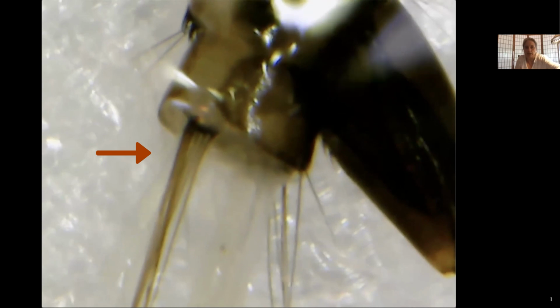There's some hairs that are coming off underneath the saddle here. And then we have a big clump of hairs here. We call this the ventral brush. So remember these things because we're going to talk about these when we are, okay, this is a close-up now of our siphon, and I want you to think about the hairs you just saw, and then I want you to focus in on that little row of sharp, spiky protrusions that we see on the left-hand side of the siphon.